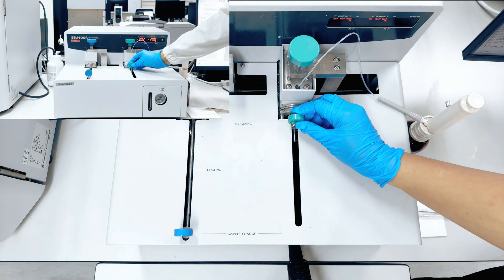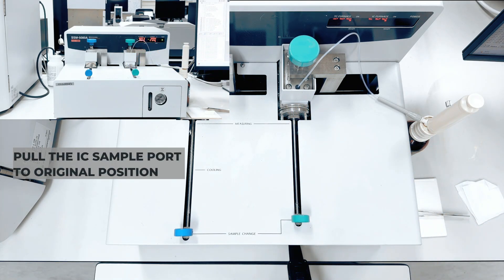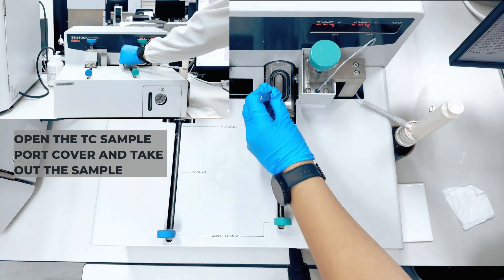When the measurement is completed, pull the port to the original position. Lastly, open the cover and take out the sample.